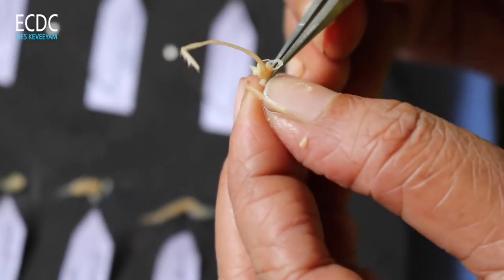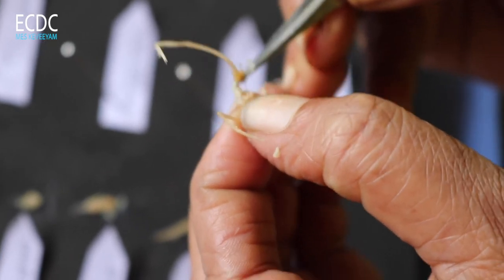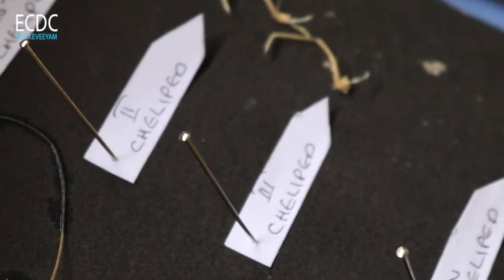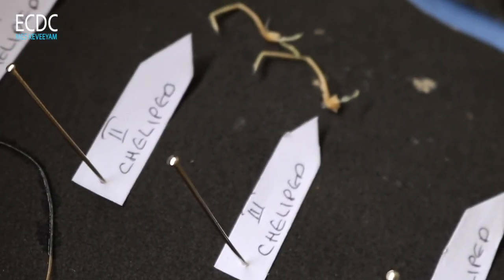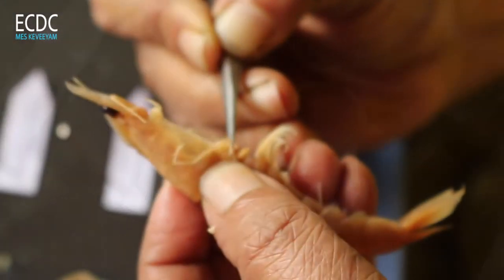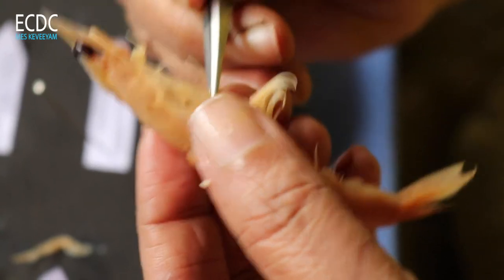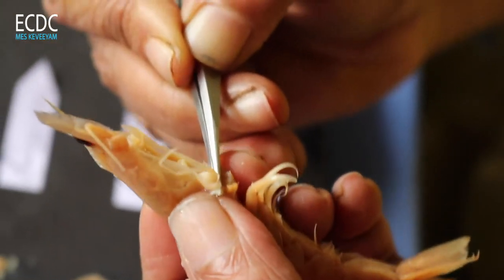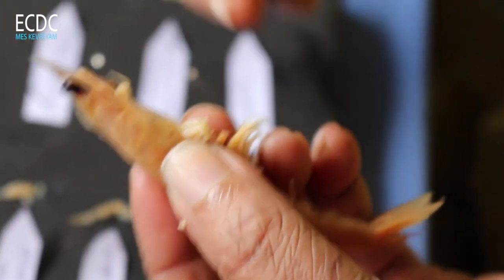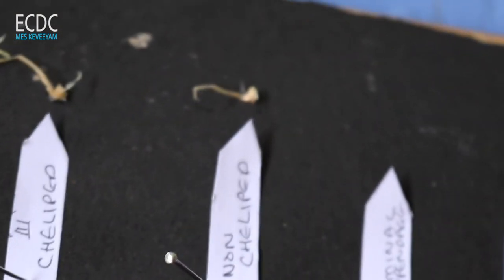This side will be cut. Now we have nonchelate legs — two nonchelate legs. First leg. Let's do the same thing. We will start here with the first leg.